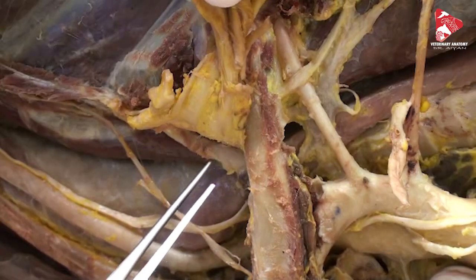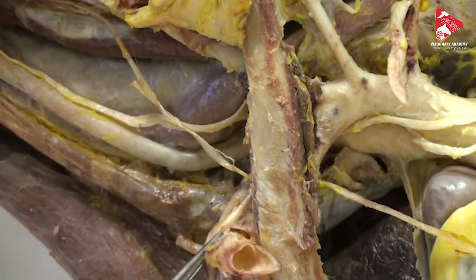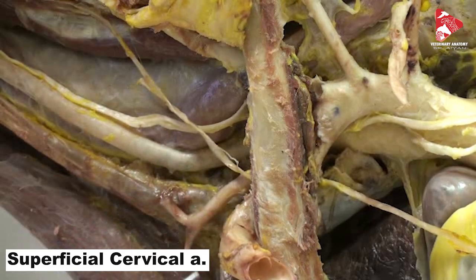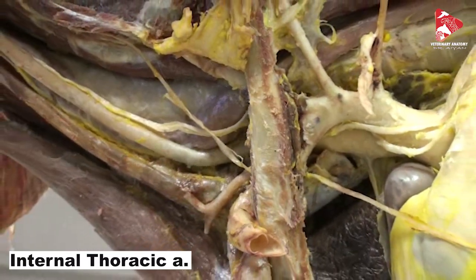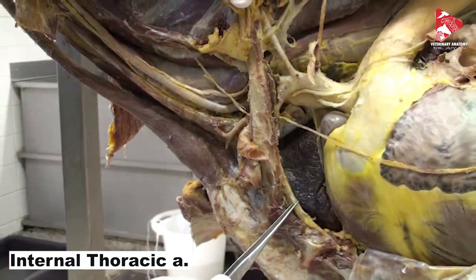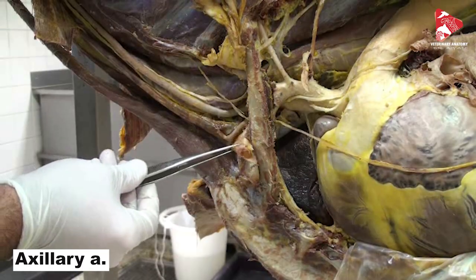From the left subclavian artery, before it exits the thoracic cavity, we have the superficial cervical artery, which moves toward the neck. Another branch from the left subclavian artery inside the thoracic cavity moves along the dorsal surface of the sternum backward and leaves the thoracic cavity between the last few ribs — this is called the internal thoracic artery.